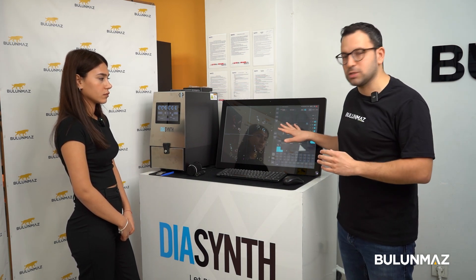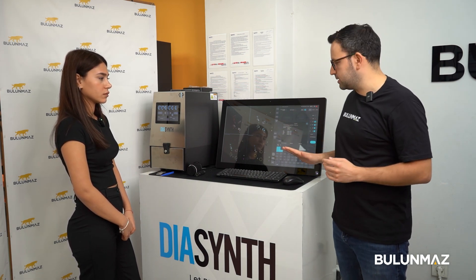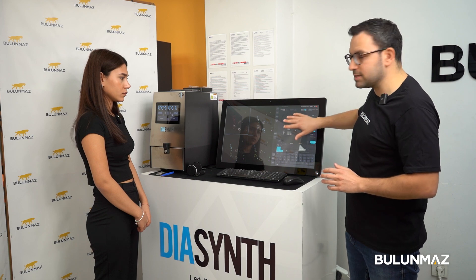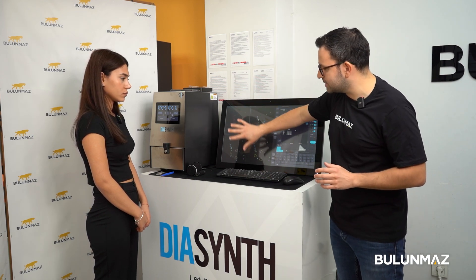You can also save your test as a PDF, print it out, give it to your customer, attach it to your physical certificate, or whatever you want — it can be totally printed out.